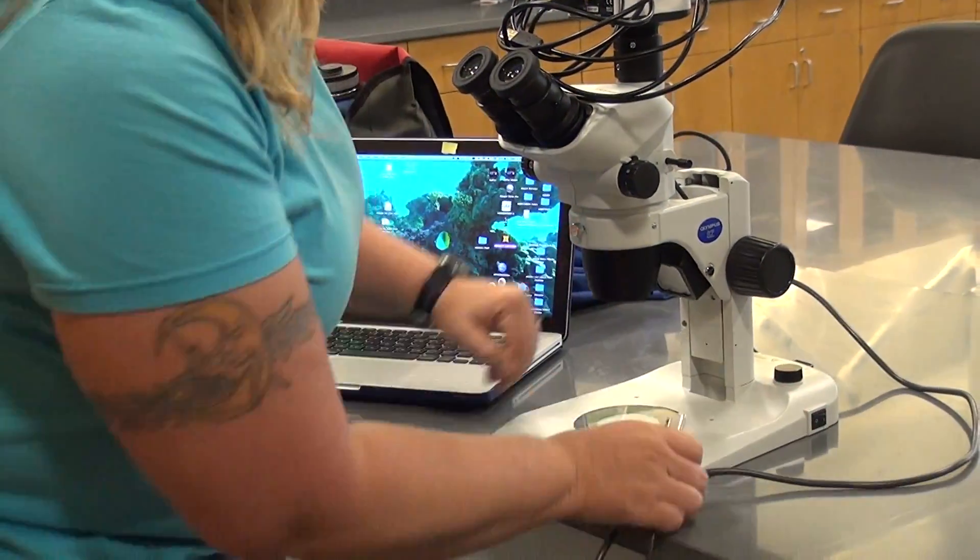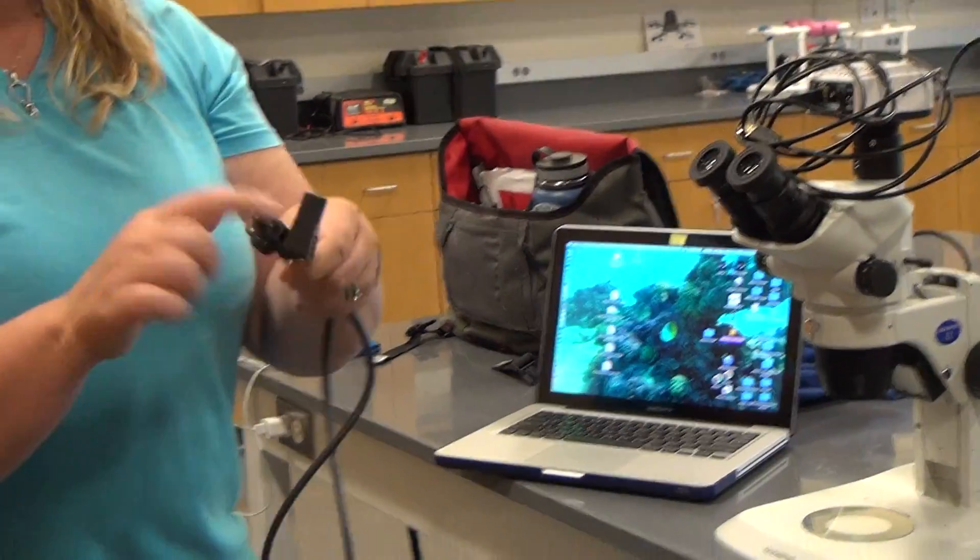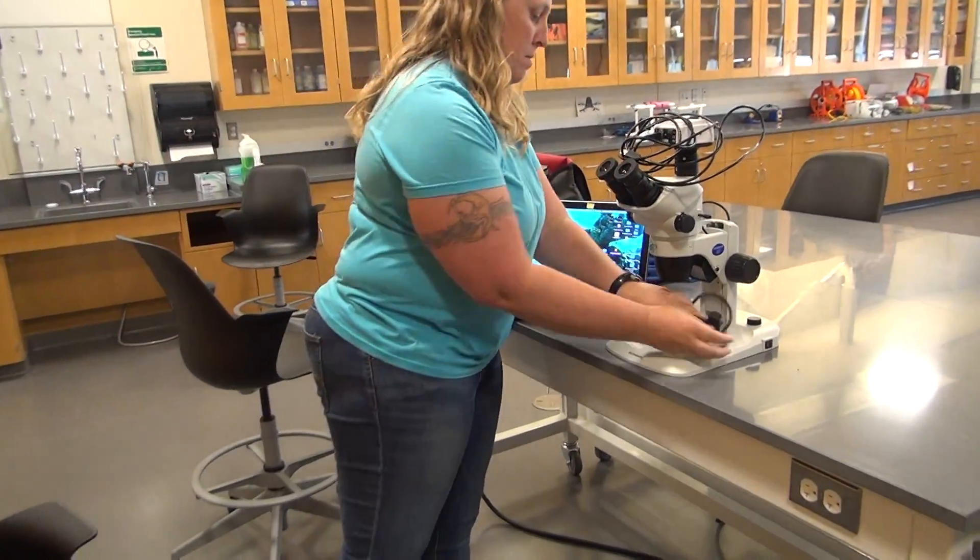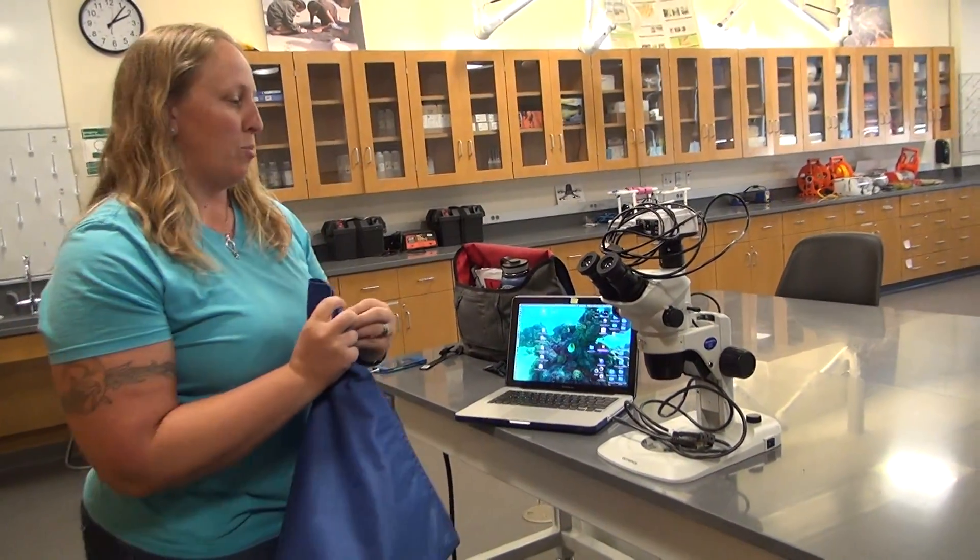Unplug. Turn off. This comes out to also not create stress on the port. And put it away in the cupboard. And you're done. Thanks Dorothy. Bye.